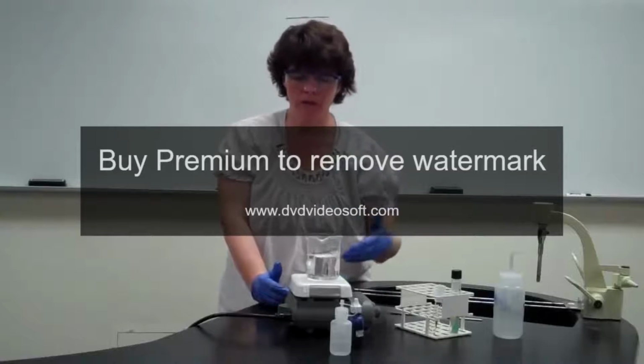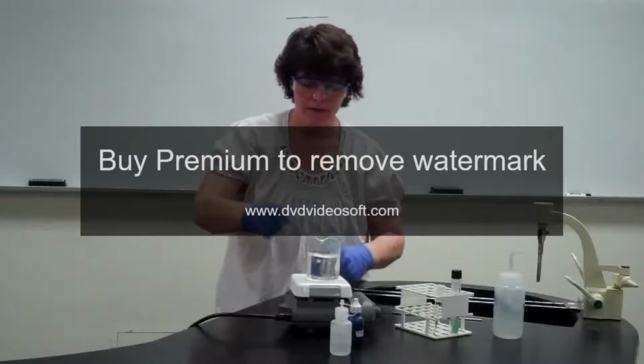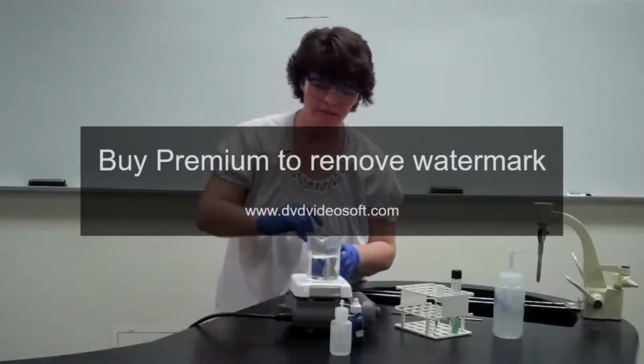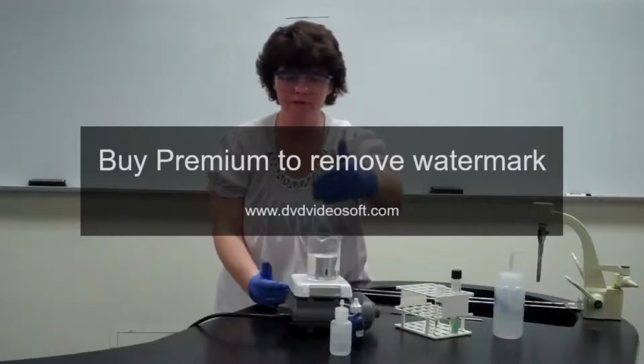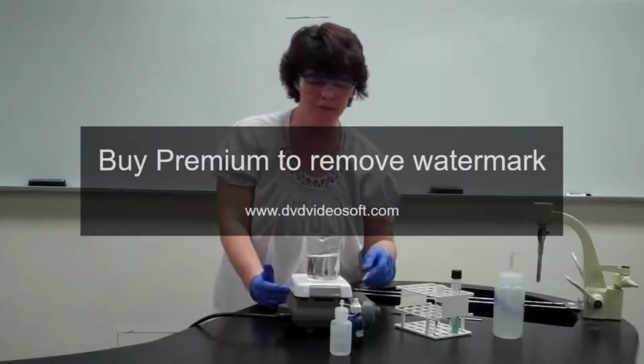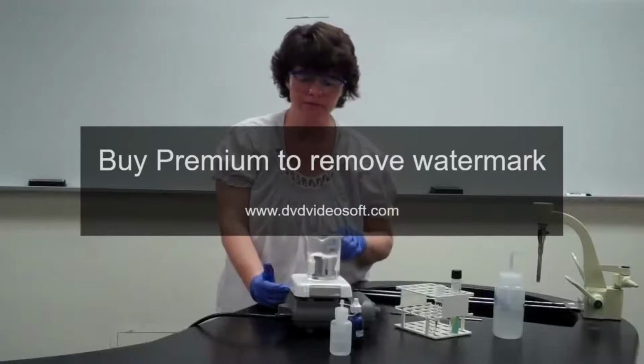So as it's going along steaming for 5 minutes, keep an eye. If it looks like it's drying, add some more stain. Okay? Try not to let it run over too much. Like I said, just enough to cover it, but not so much that the water's turning color. We have to clean the beakers, and it's a little difficult when they have too much stain in them.